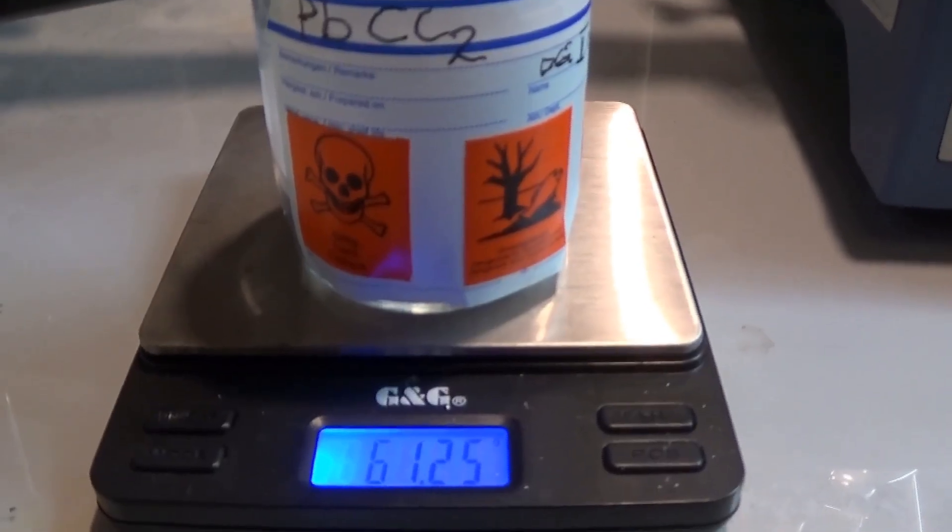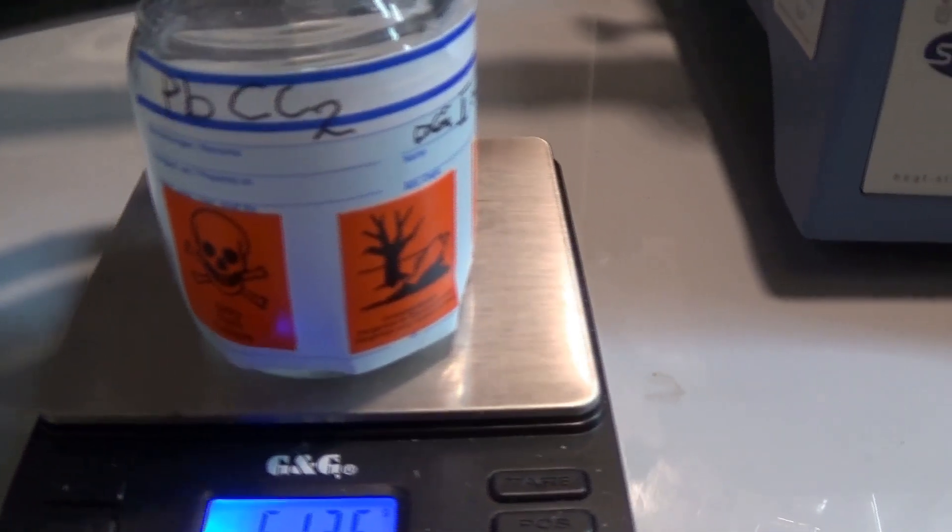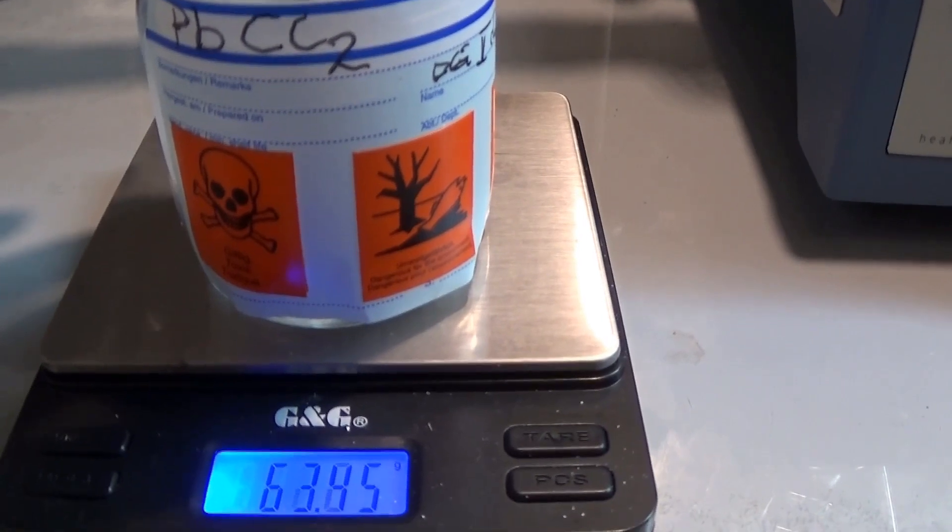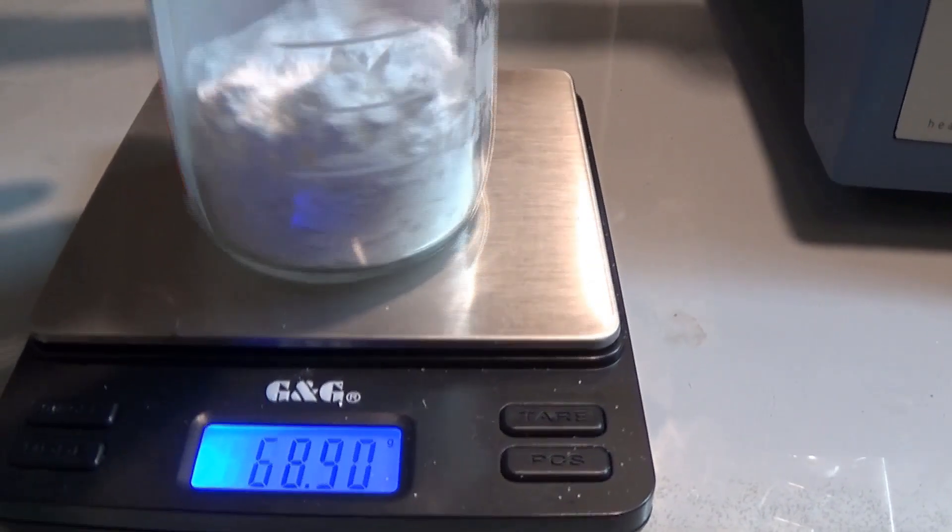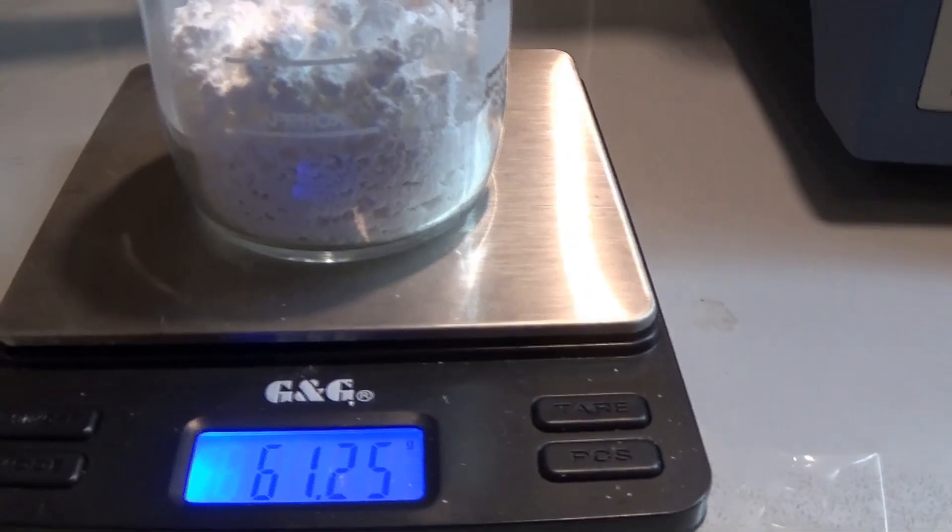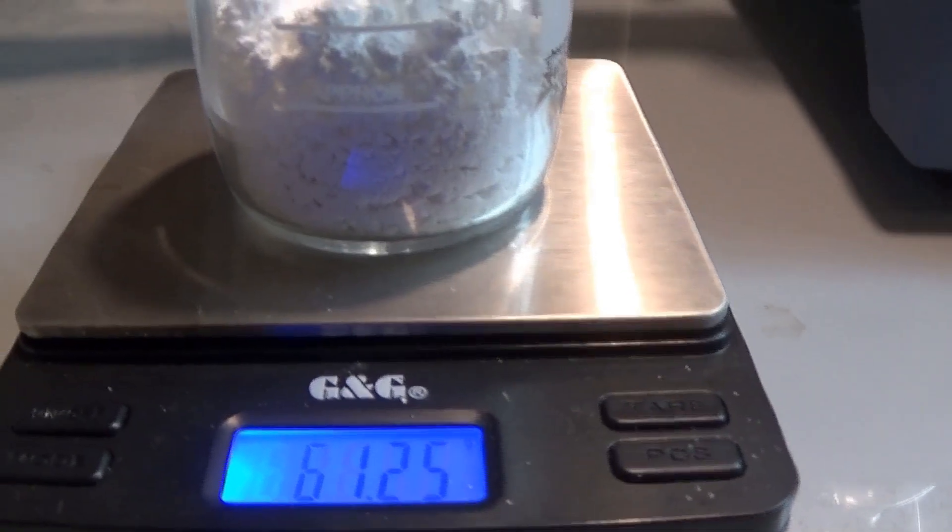In the end I got 61.25 grams of PbCl2. Not bad for a complete failure. So have fun and do not kill yourself.